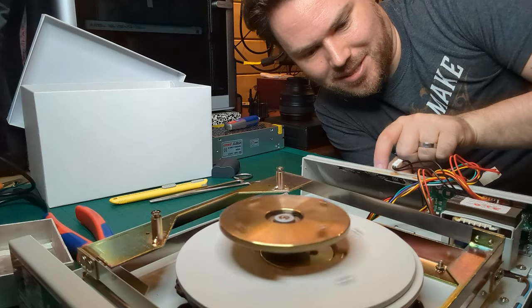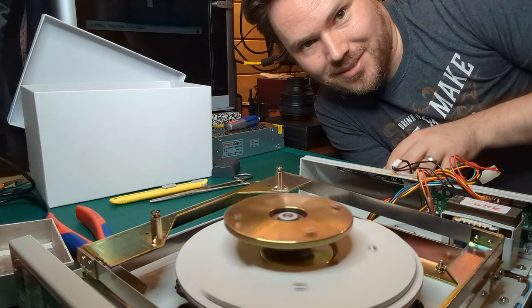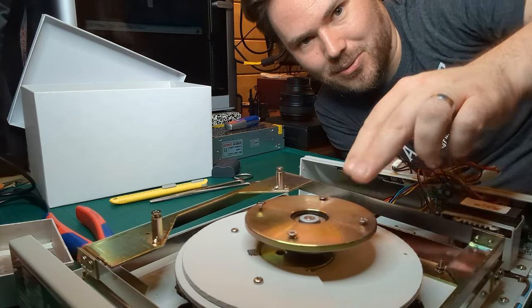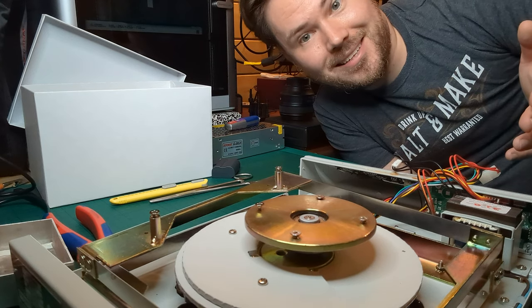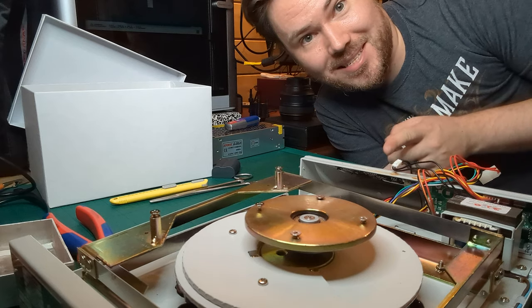So if I press the stop button, a bit difficult when it's moving around, but there we go. You can hear it powering down. I'm just going to put a bit of force back into it. And hey, one part that cost a few pence, and this thing is fixed. I can't really believe it was that simple. One tiny part, and this thing is back to full function.